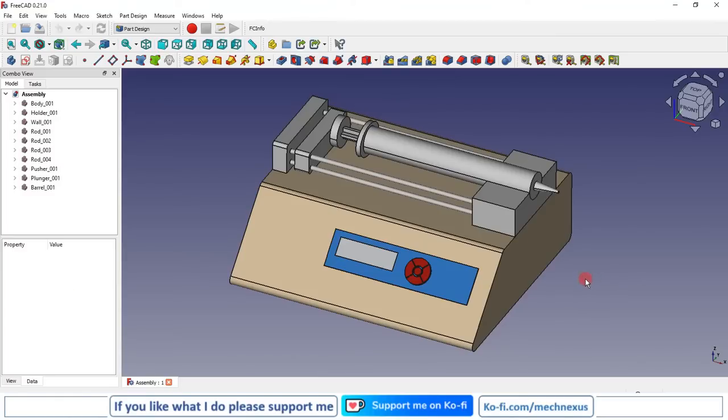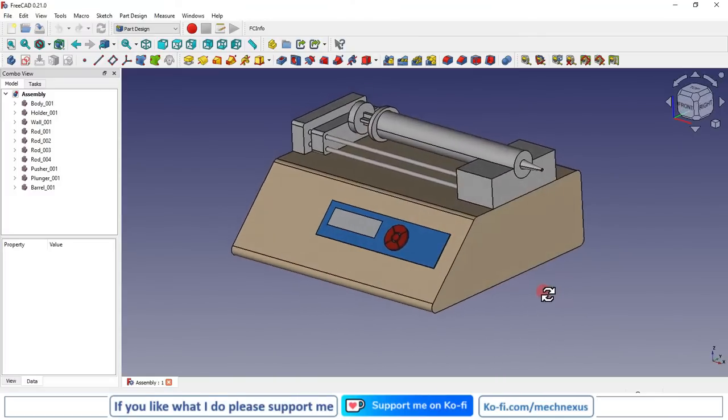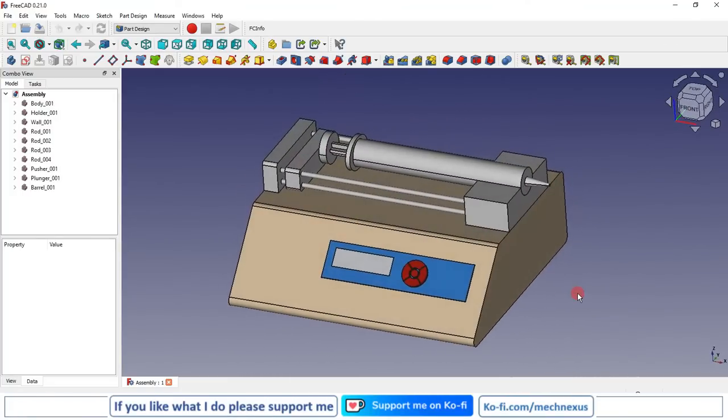Hello friends, welcome to FreeCAD tutorial, and in this tutorial we will learn assembly in FreeCAD. We will use A2 plus Workbench in FreeCAD to create assembly. Here I have done an assembly of a syringe pump with the help of A2 plus Workbench, and I will show you from the scratch how you can do the same in FreeCAD.